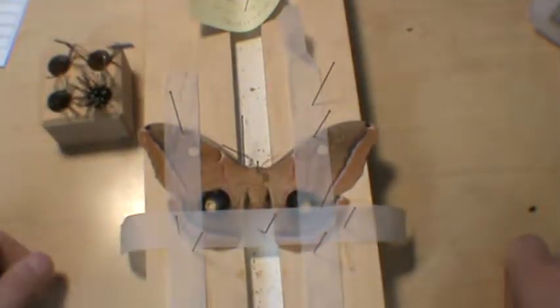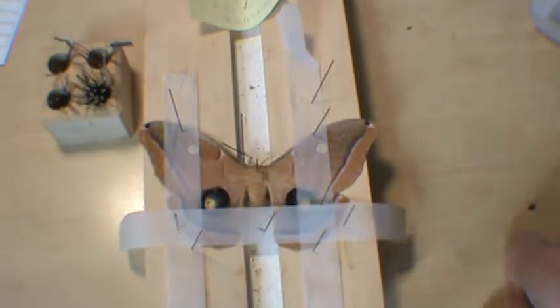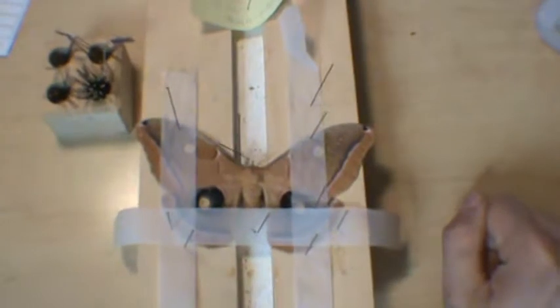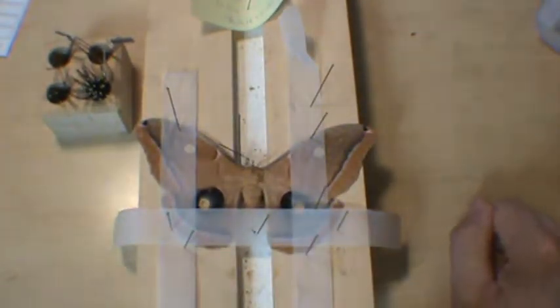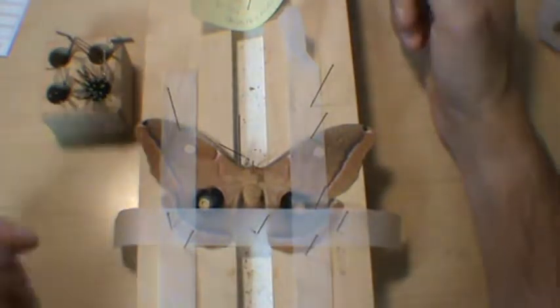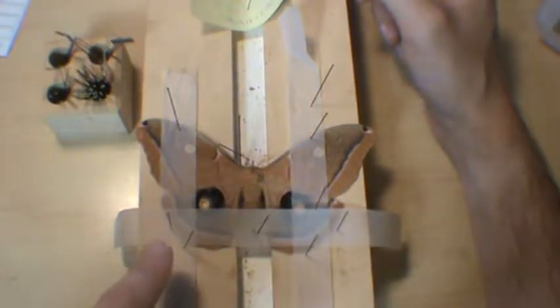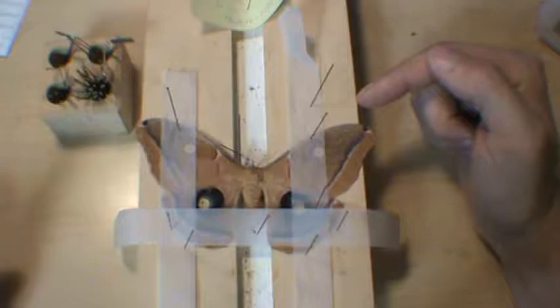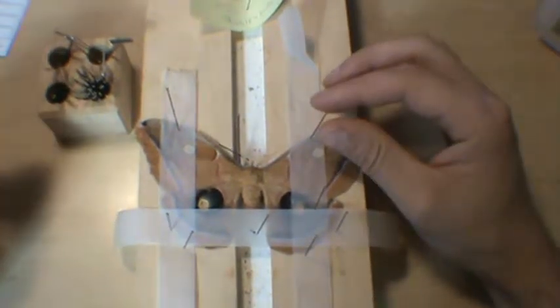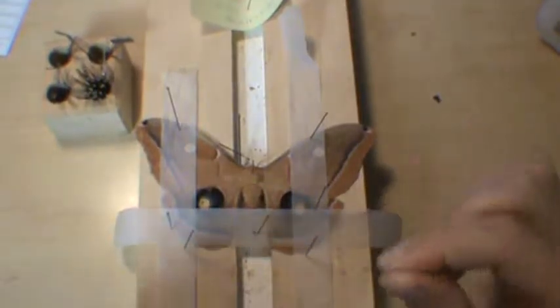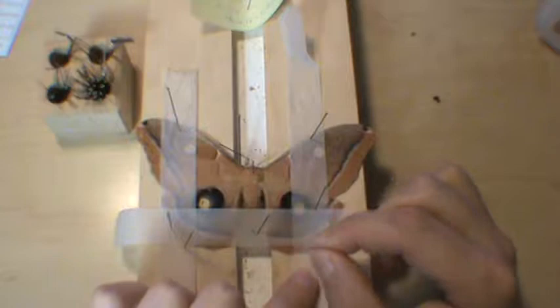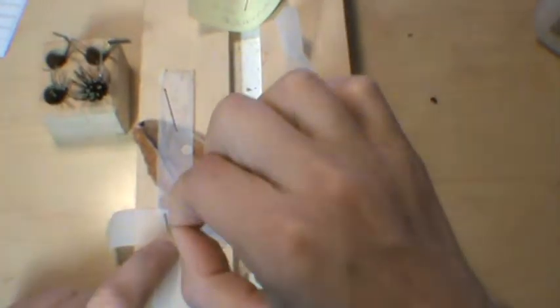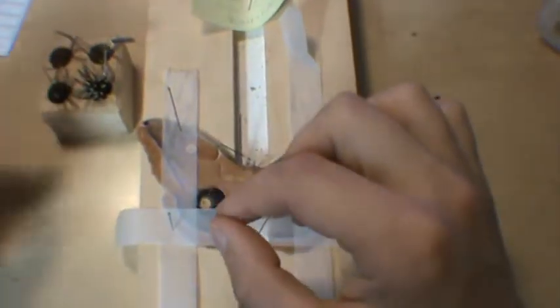I've got my little pin block here. We're going to start taking the tape off. This is kind of weird because I'm sitting behind the tripod of the camera. I haven't figured out a good way to do this yet. Does that look like a good place to start? I think we've got to start over here. We'll just pop these off.